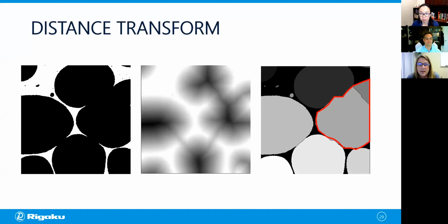Okay, so then what we see in this red outline is we have 2 objects. They're 2 different grayscales, but instead what they really should correspond to is a single object. So this is an example of what we call over segmentation, and this can easily be fixed, not to worry. We can merge these objects, and I'm going to show you how to do that today. So that'll lead us to our next part, where we're going to do our interactive stuff.